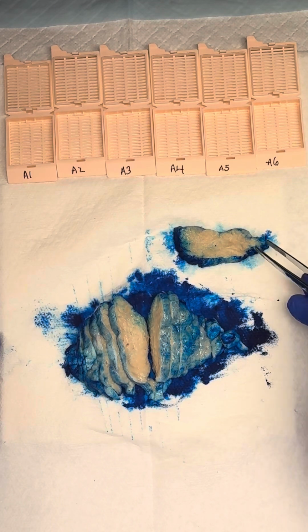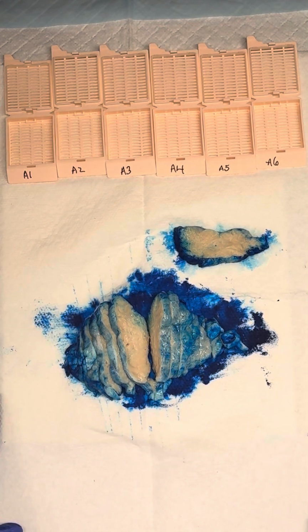Then, after you've given all of your descriptions of your mass, you can describe your uninvolved thymus parenchyma. In this instance, we don't have any uninvolved parenchyma remaining, so we would give that as a pertinent negative. The other thing that we want to make sure we comment on with our mass is if we have adherent structures to the outer surface, so measuring the distance of that mass to those adherent structures, and discussing if the mass is involving those adherent structures. That will be pertinent for staging purposes.